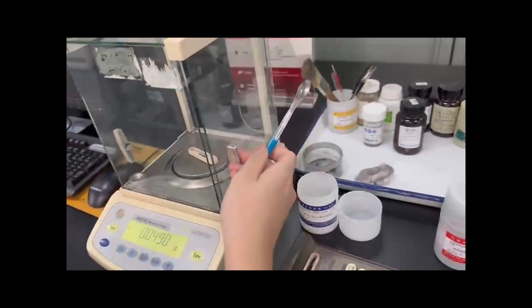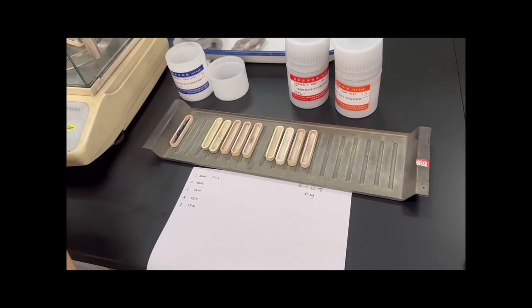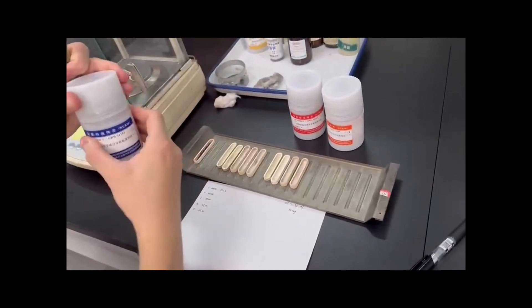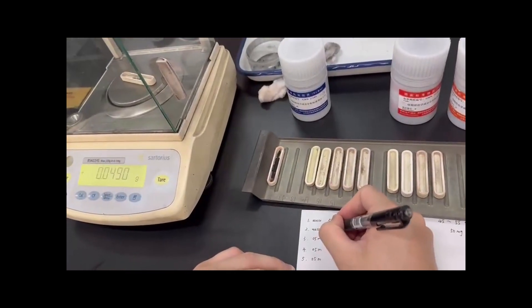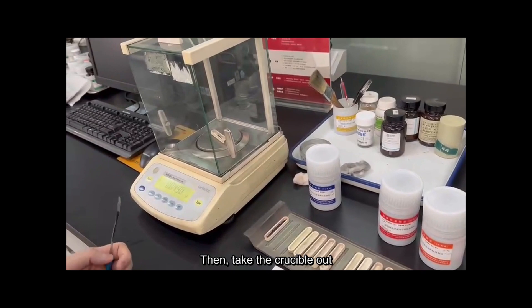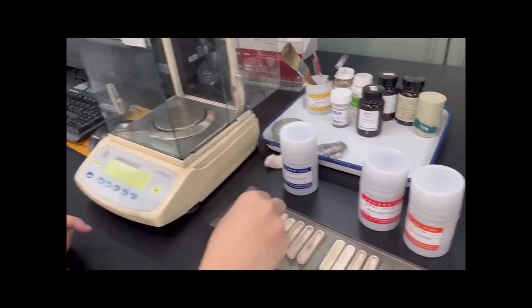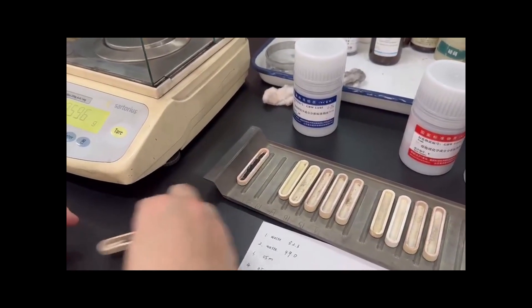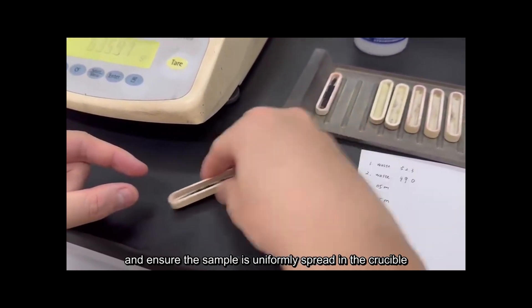Close the window and record the mass. Then take the crucible out. Shake the crucible to ensure the sample is uniformly spread in the crucible.